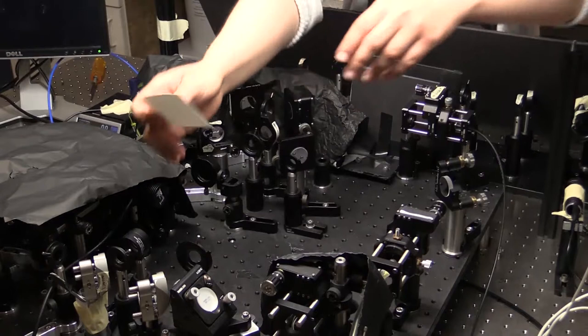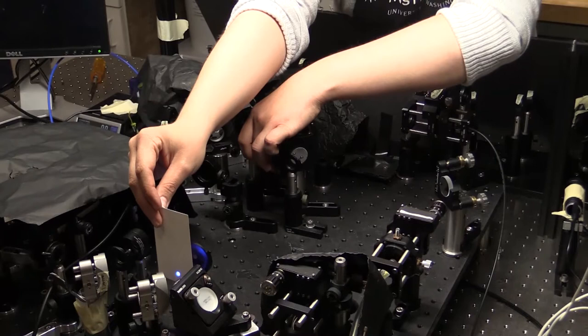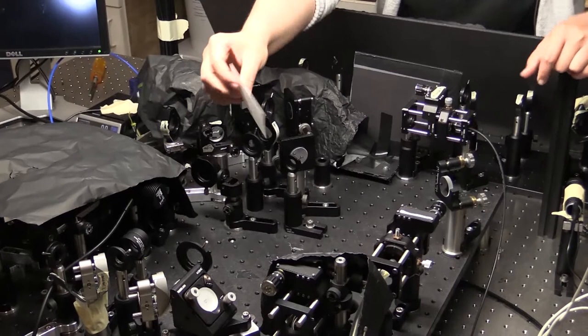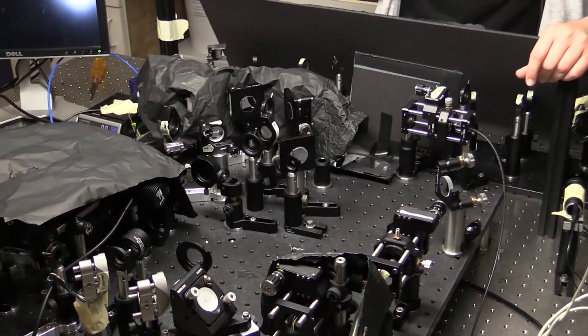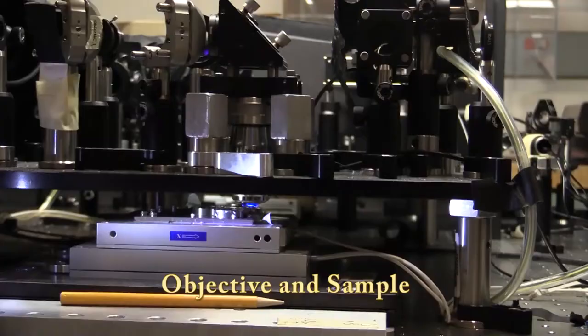Then I go to my second mirror and my second iris and do the same procedure again — I close the iris and see if the beam is going directly through it, and I adjust the horizontal tilt of this mirror to get it centered through the iris. I have to then iterate this process many times until my beam is centered nicely through both irises. Once it's horizontally aligned I then repeat the process making sure that the beam is aligned in the vertical direction as well, using the first mirror to adjust for the first iris and the second mirror to adjust for the second iris. Once my beam is going directly through the irises, I now know that I can put my beam back to exactly where it was even if something gets bumped or drifts.